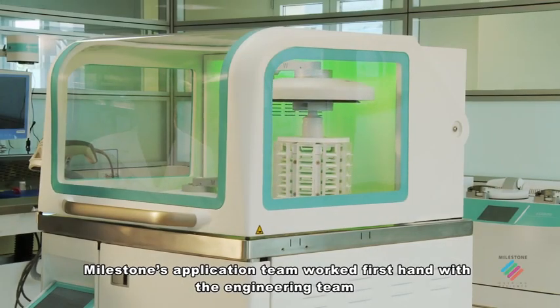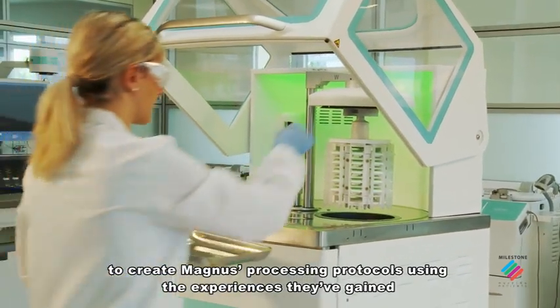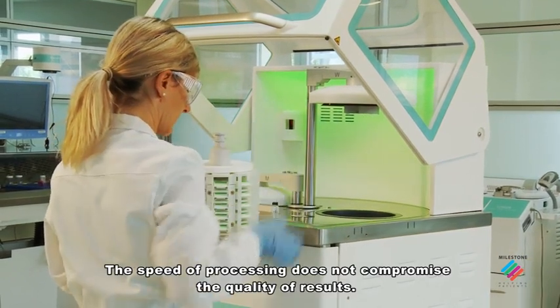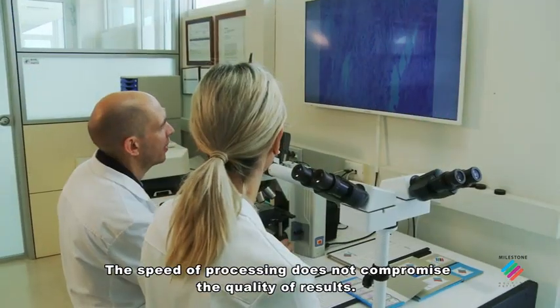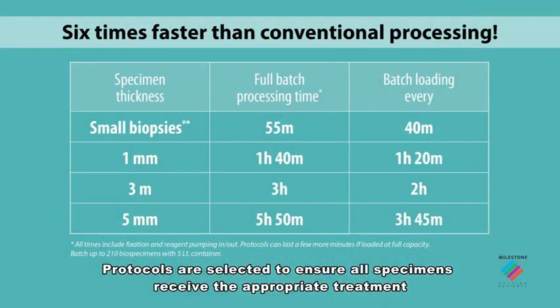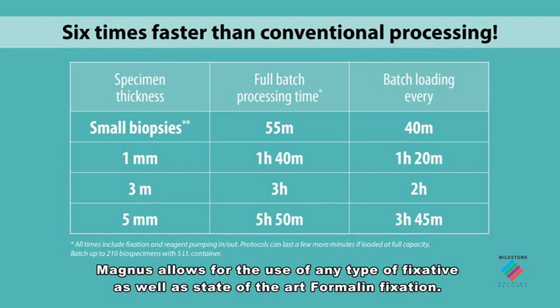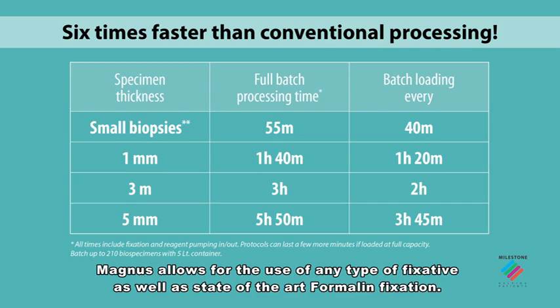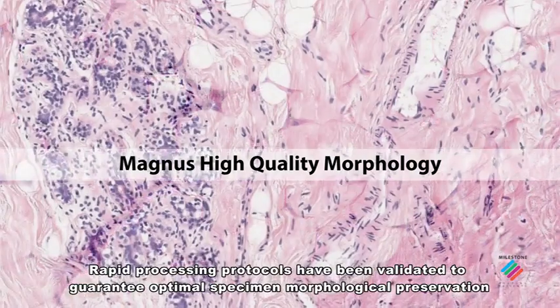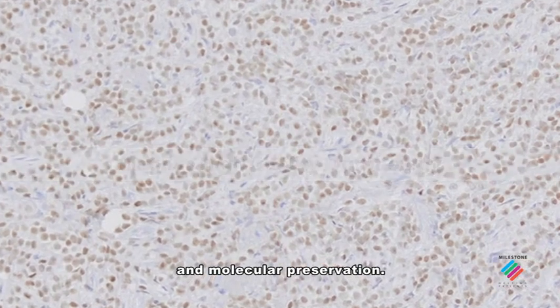Milestone's application team worked first-hand with the engineering team to create Magnus processing protocols, using the experiences they've gained over more than 20 years of working with rapid processing. The speed of processing does not compromise the quality of results. Protocols are selected to ensure all specimens receive the appropriate treatment according to tissue type and dimensions. Magnus allows for the use of any type of fixative, as well as state-of-the-art formalin fixation. The rapid processing protocols have been validated to guarantee optimal specimen morphological preservation and molecular preservation.